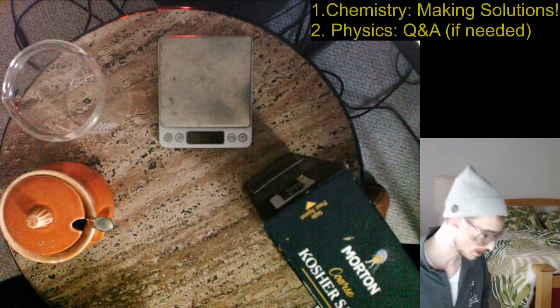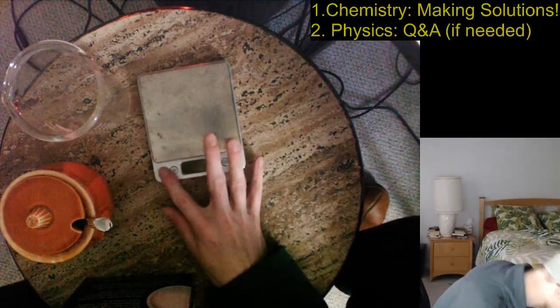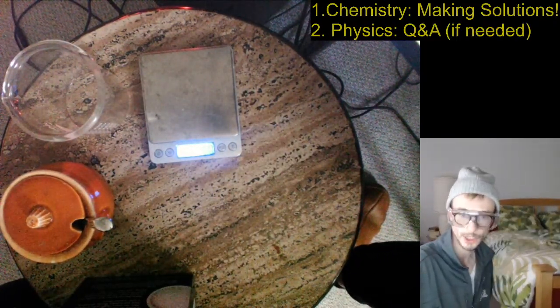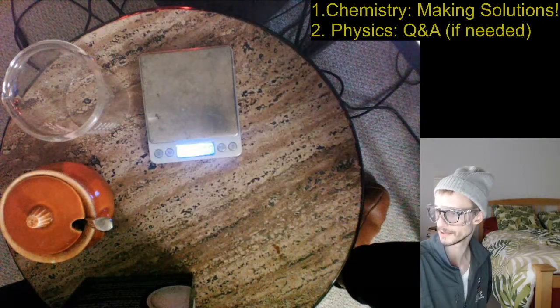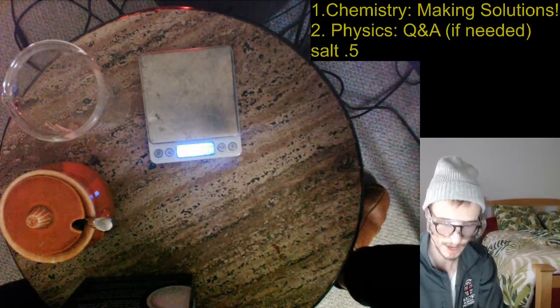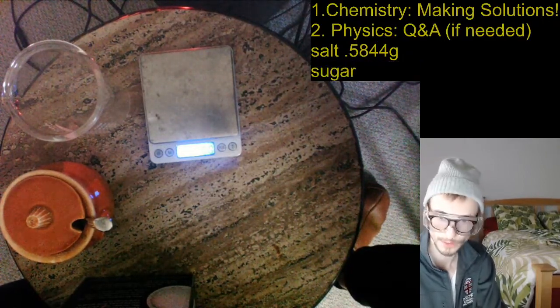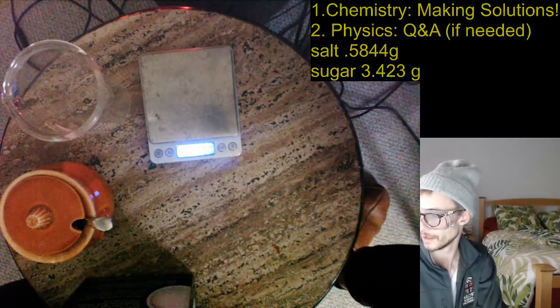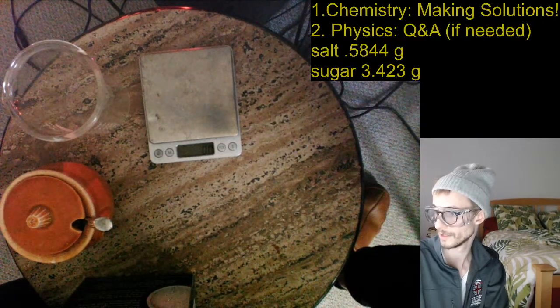So, first step, let's measure out some of the salt. Oh, I killed it. Here we go. So, if I remember correctly, I need 0.5844 grams of salt. Maybe I'll add that to my text thing here. So, salt is 0.5844 grams, and then sugar was 3.423 grams. Okay. We got it.